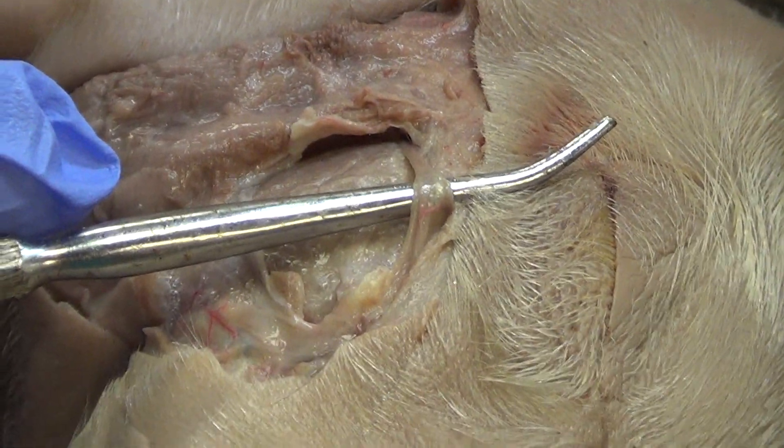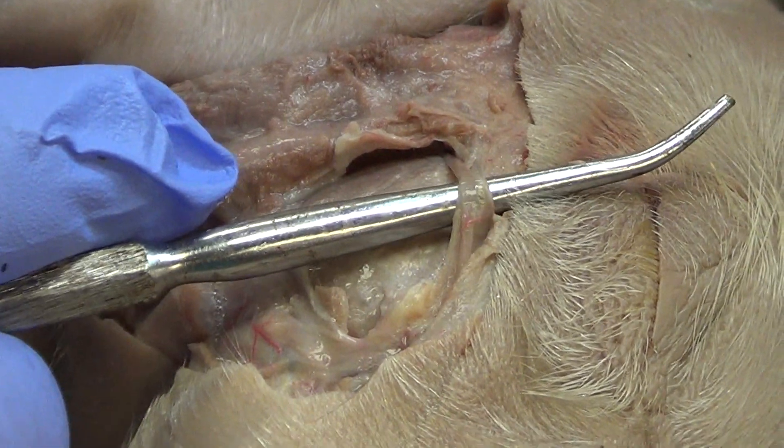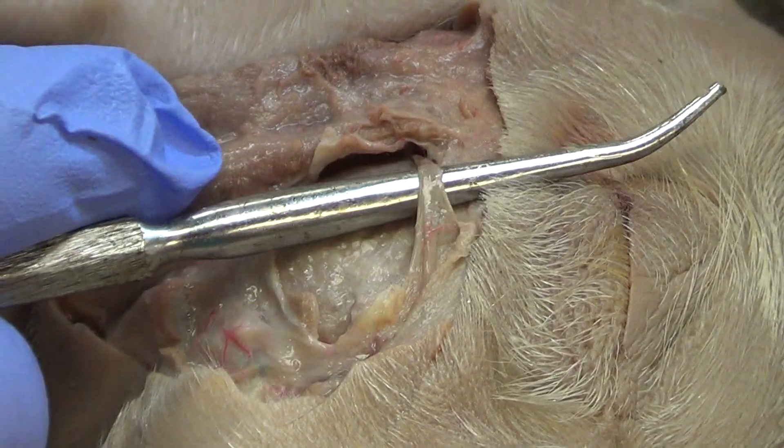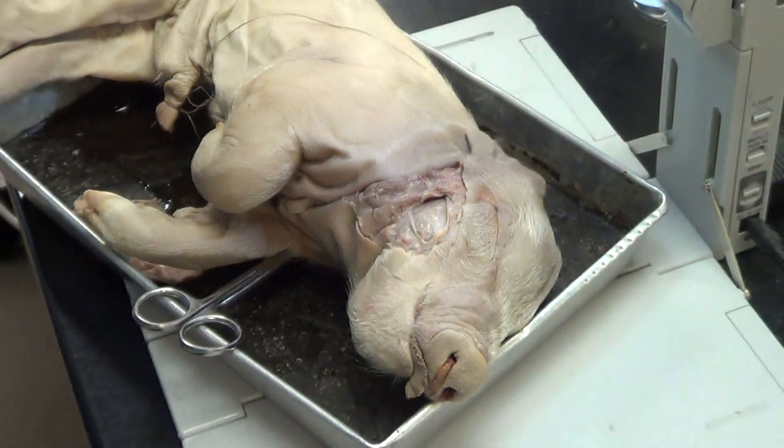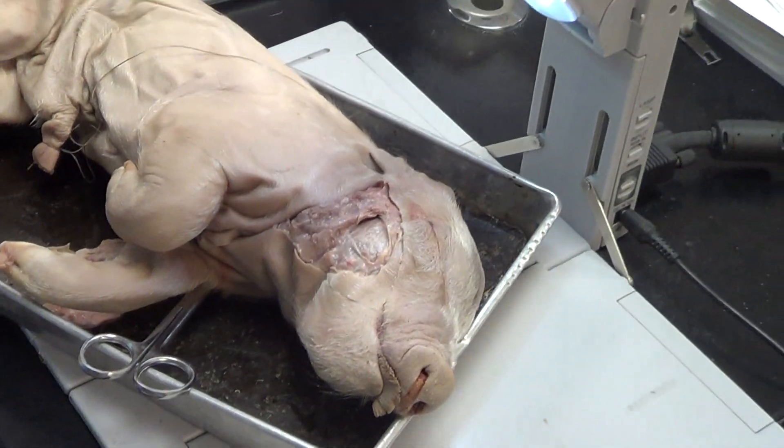You will need to do the same thing — that's called an isolation. By the end of the day I should be able to take my probe and go underneath your facial nerve like this. Some of you will cut or break the facial nerve; your goal is not to do that today.